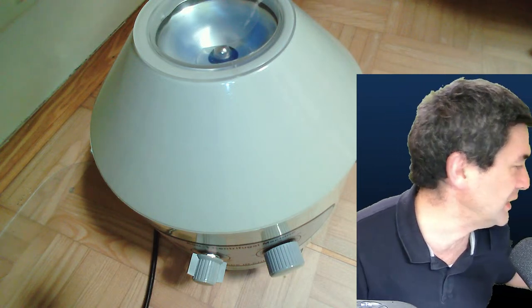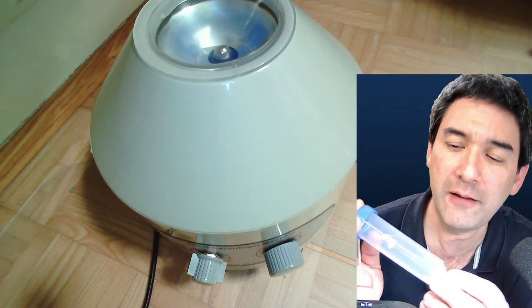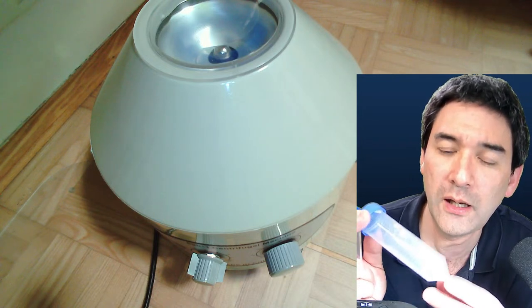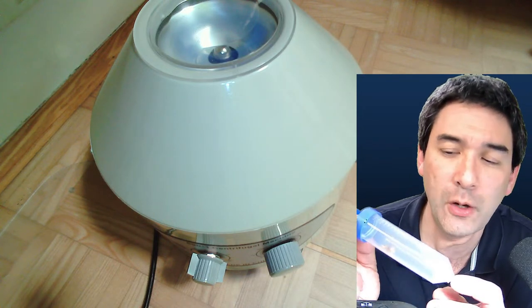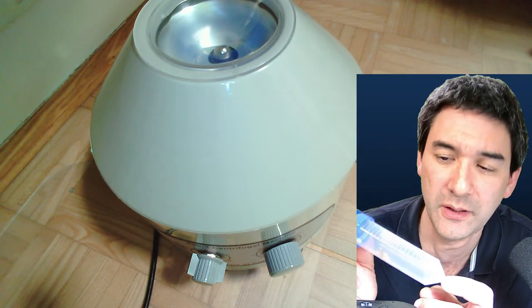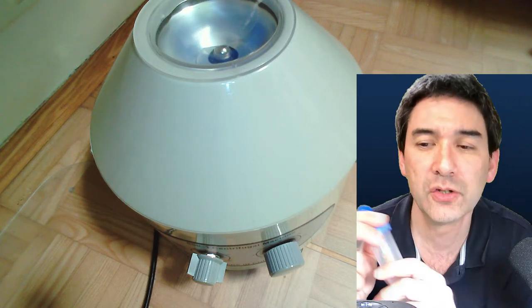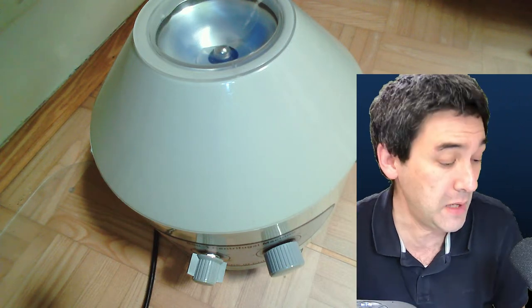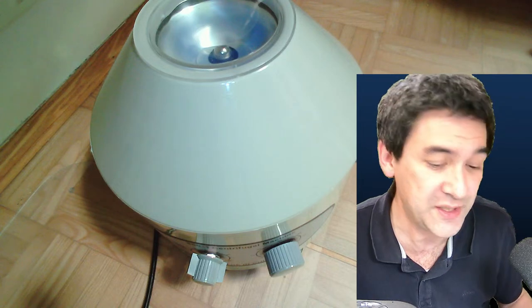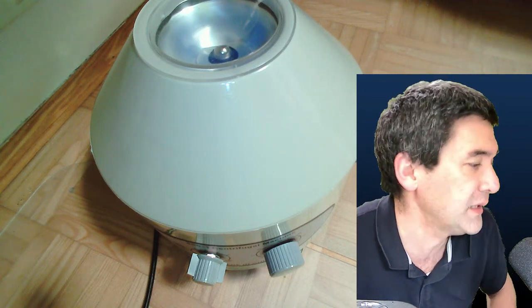I have slightly larger centrifugation tubes that I use for collecting samples for microscopy. I'm just going to leave the centrifuge running now and we're going to see how well this actually works.